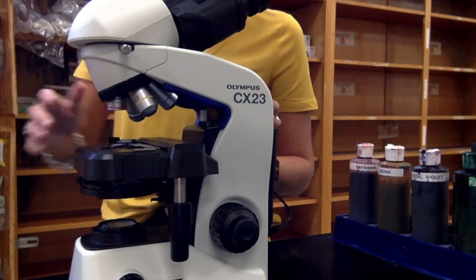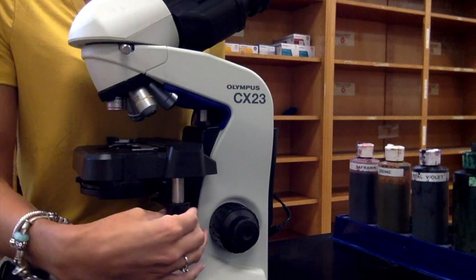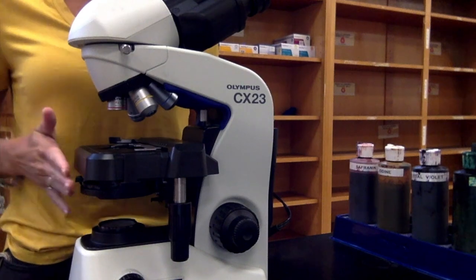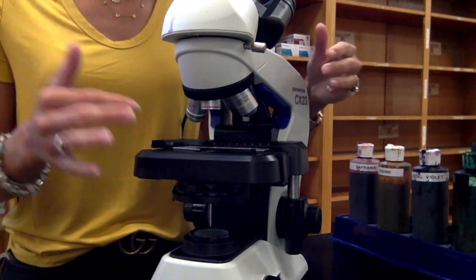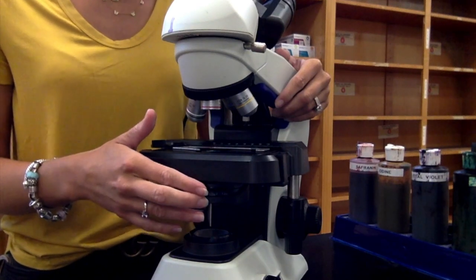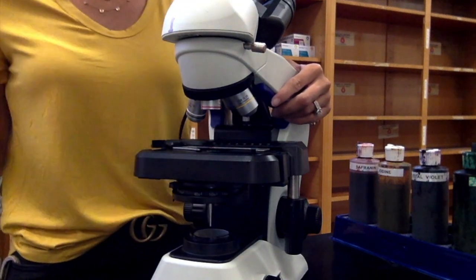Then we have our stage and our stage clips — that's where the slides actually go. We have the stage adjustment knob, which moves the stage up, down, and side to side so you can move your slide around to find a good place on your smear. The condenser is underneath — it helps focus the light coming in. The iris diaphragm is in the front and helps control the amount of light you're getting. So if your smear looks washed out, you can close it. On the 4x if it's looking really bright, shut it to eliminate some of the light, but at 100x we usually like to have it all the way open.